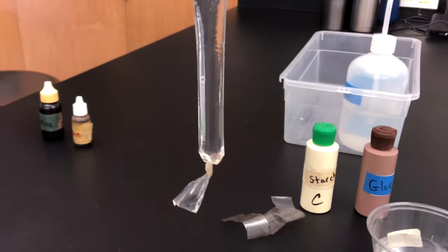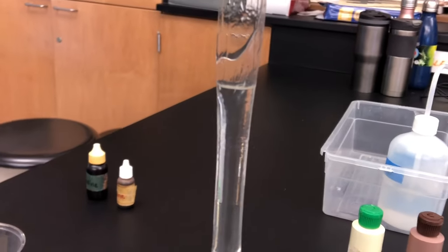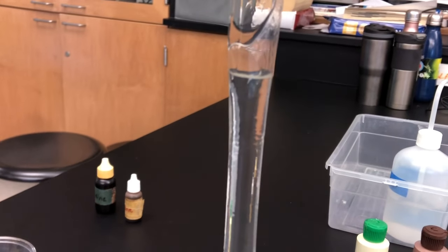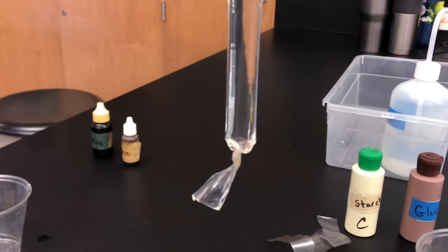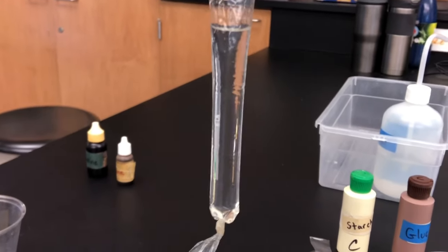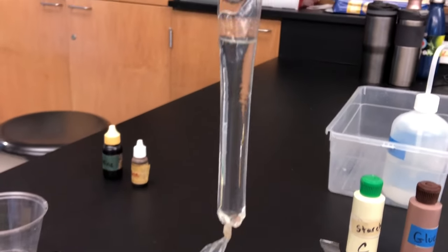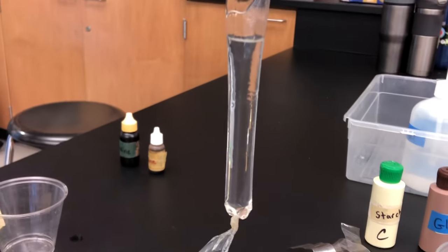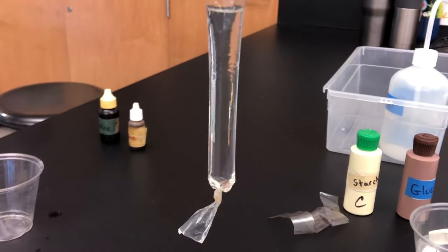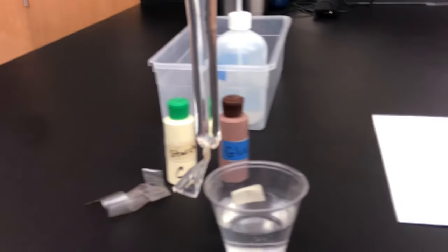Dialysis membrane is interesting because the membrane is also semi-permeable. You can't see them — they're way too small — but there are little tiny pores, little tiny holes in the membrane. Because it's semi-permeable, some molecules are able to pass in and out through the pores of this dialysis membrane. That's going to be the experiment we're doing: we're going to try to figure out which molecules can pass through the pores of this membrane.